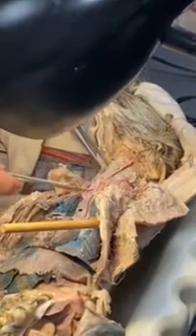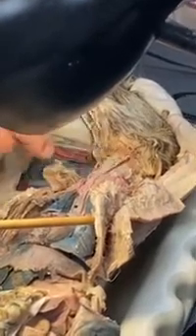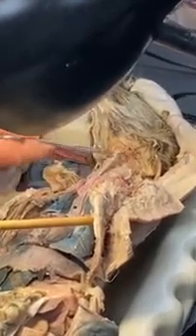Beautiful. Right subclavian. Right common carotid. Keep in mind, this right common carotid, I could stick the pin way up here too. Left common carotid. I could stick the pin way up here. That's still all left common carotid. There's the trachea. Okay. Now let's do the branches of the subclavian.